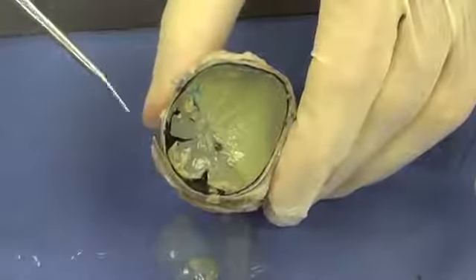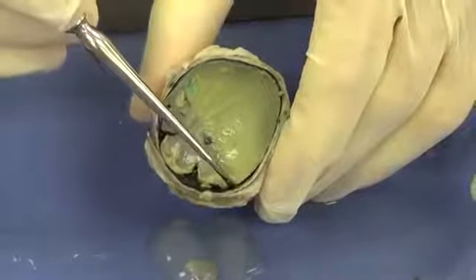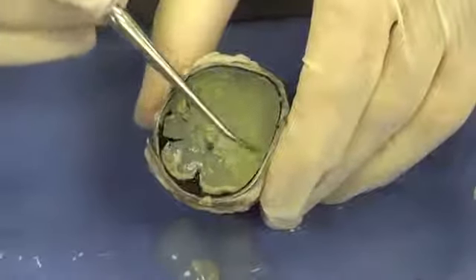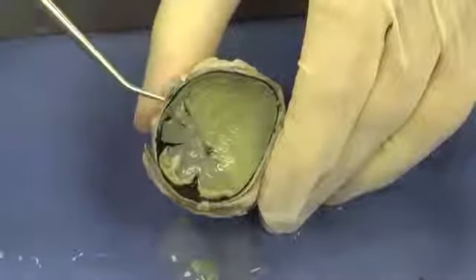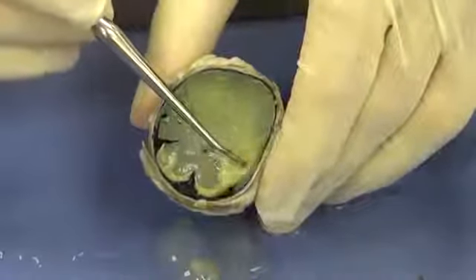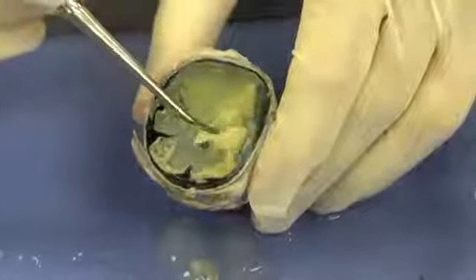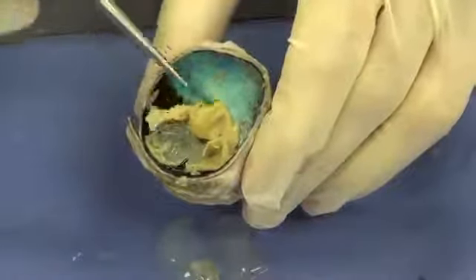But one of the things I want to talk about here is what keeps this retina pressed against the inside of the eye. The vitreous humor actually does. The vitreous humor is going to press that retina against the inside of the eye. And when the vitreous humor is not present anymore, I can easily take this retina and remove it and bunch it up. And you're going to see that when I bunch it up, it comes off rather easily, except in one place.